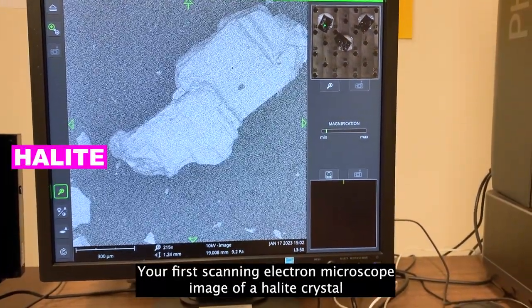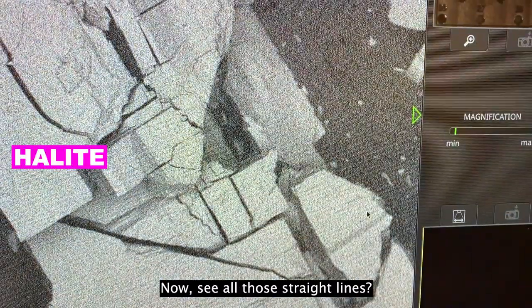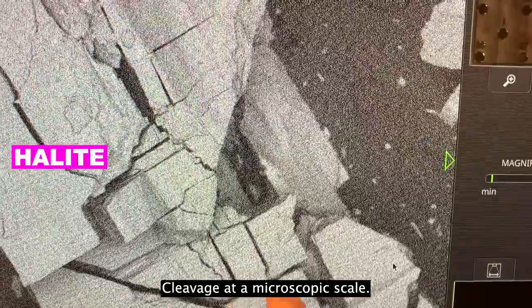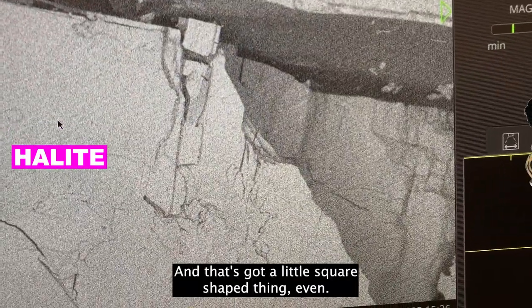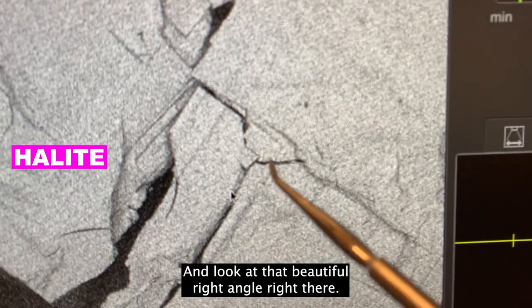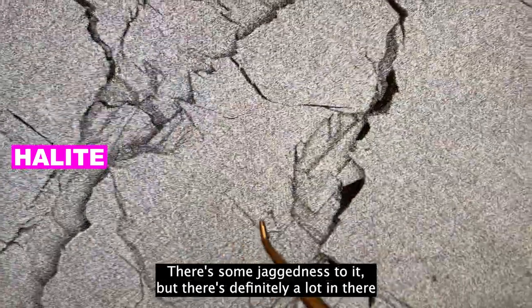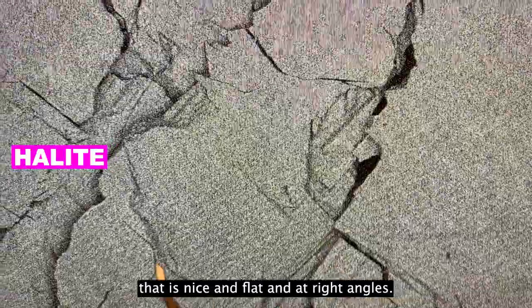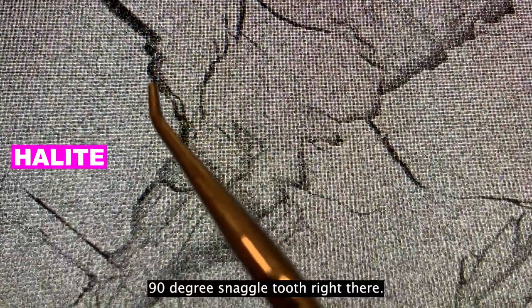And boom — there's your first scanning electron microscope image of a halite crystal, about a millimeter long. Now let's zoom in. See all those straight lines? That's cleavage at a microscopic scale. Look at all these straight cracks — this is where the crystal broke. It's got a little square-shaped geometry. We'll zoom in even more — this is about a few tens of microns wide — and look at that beautiful right angle right there, straight lines everywhere, and more right angles. Not every crack is perfectly flat; there's some jaggedness, but there's definitely a lot of nice flat surfaces at right angles. Look at that little 90-degree snaggle tooth right there — that's not a coincidence, that's cleavage.